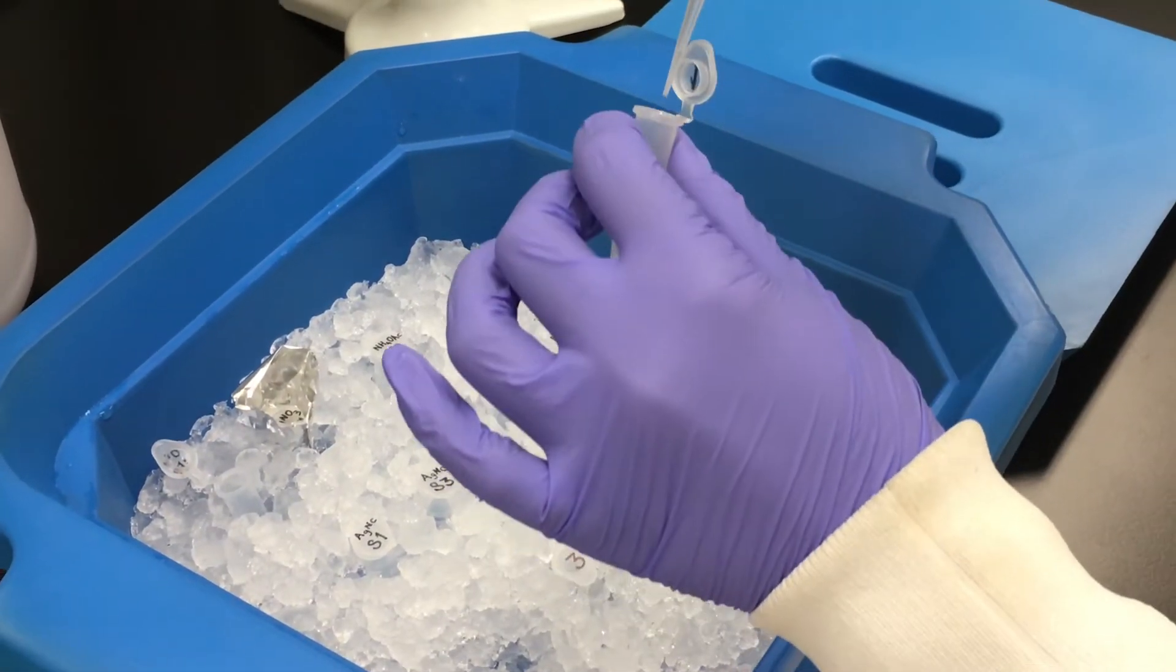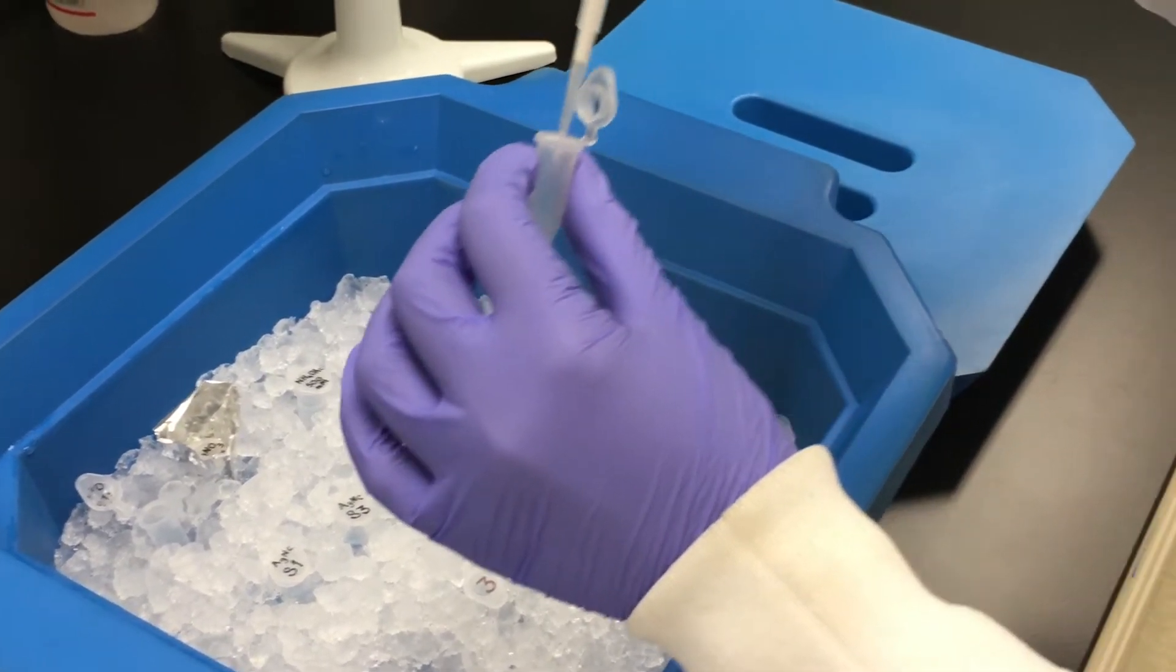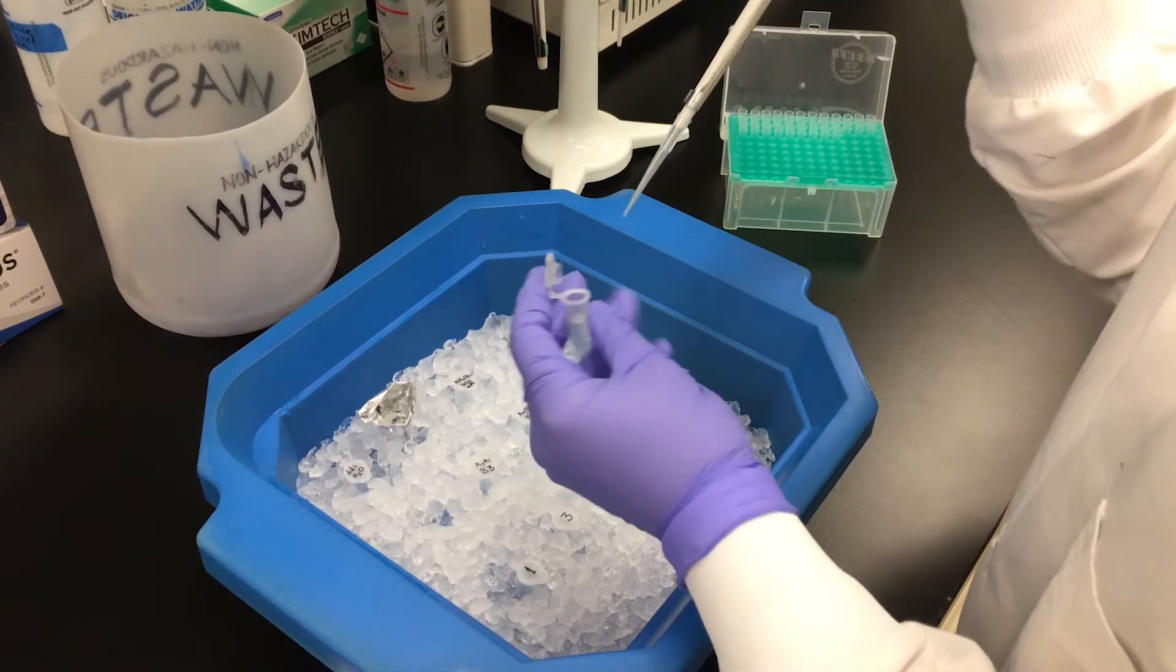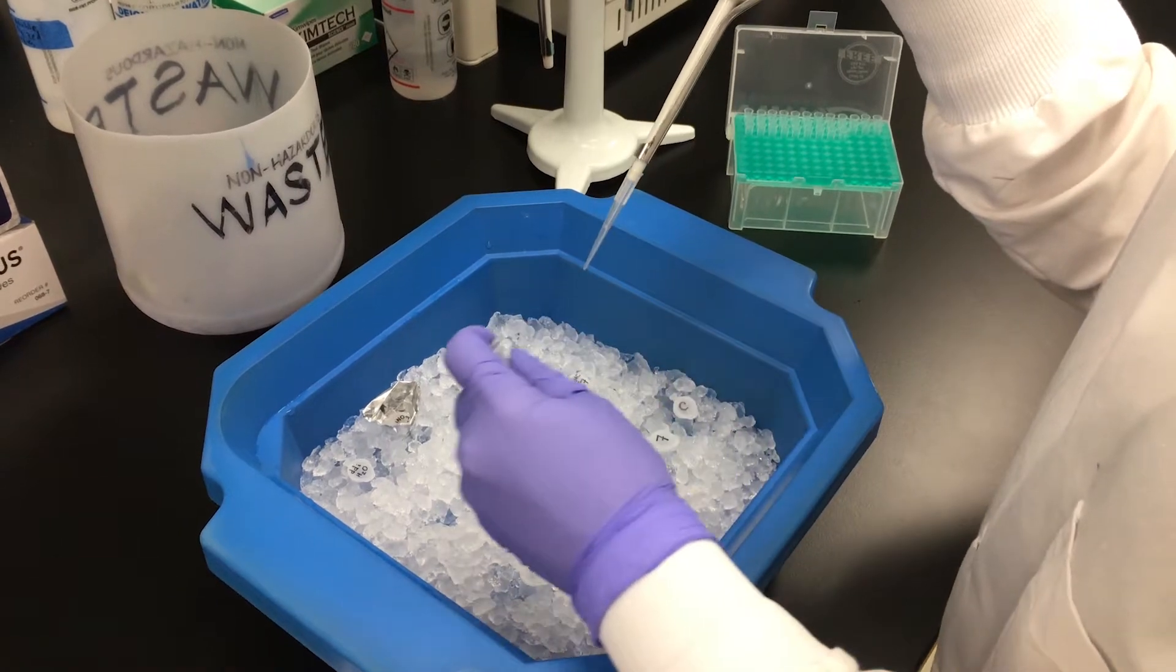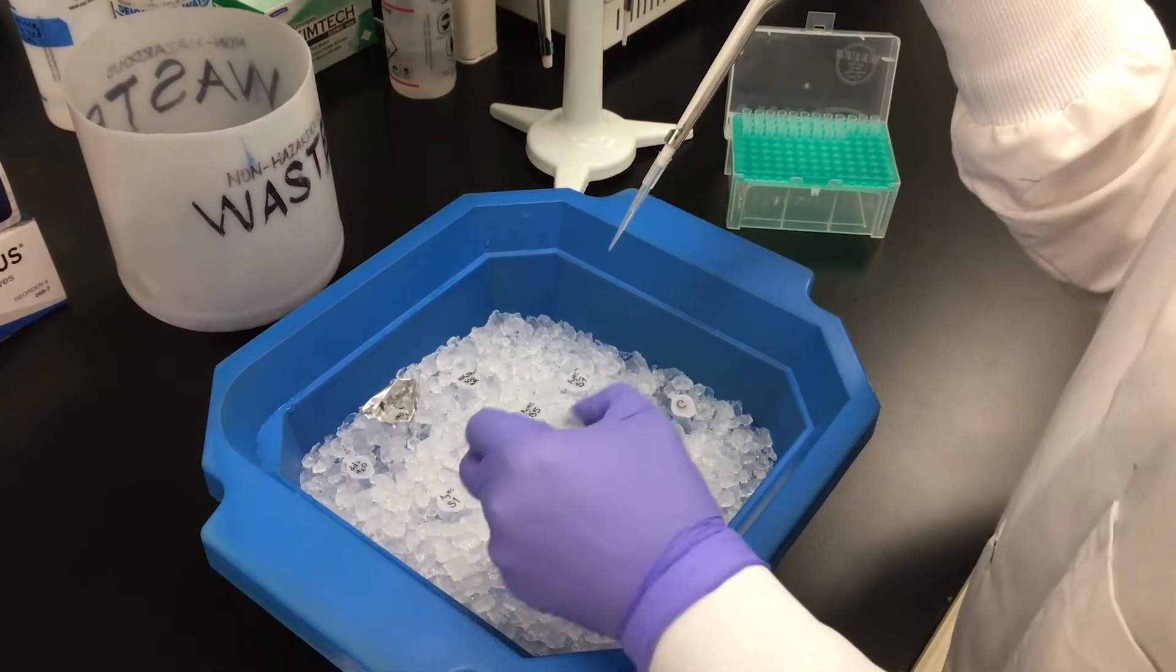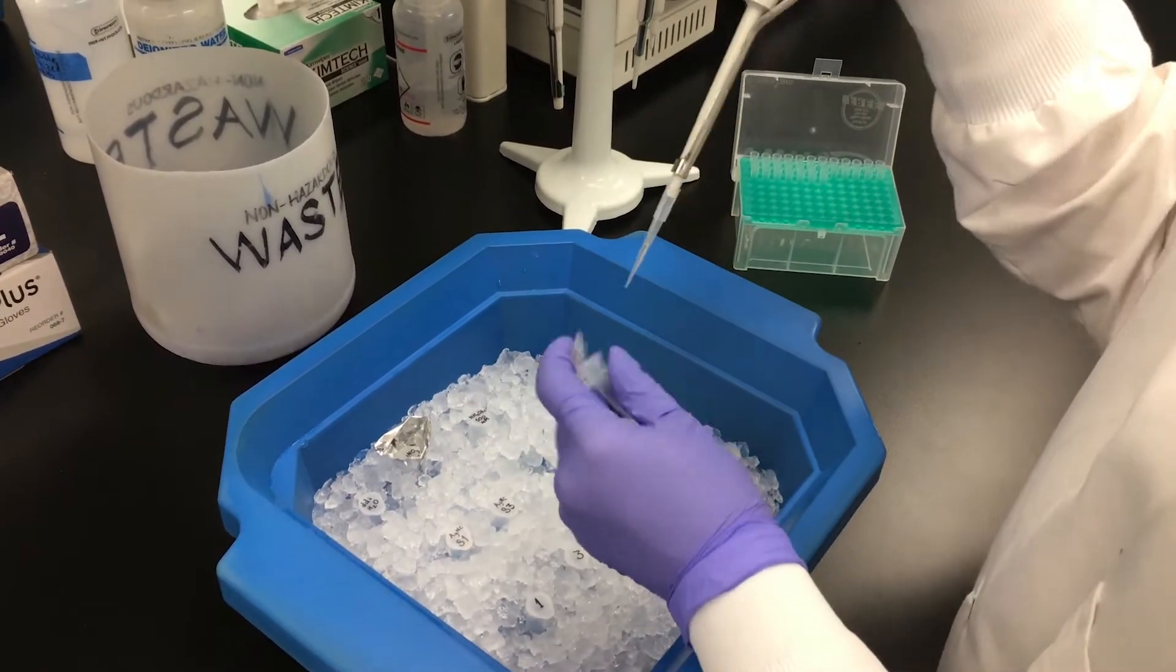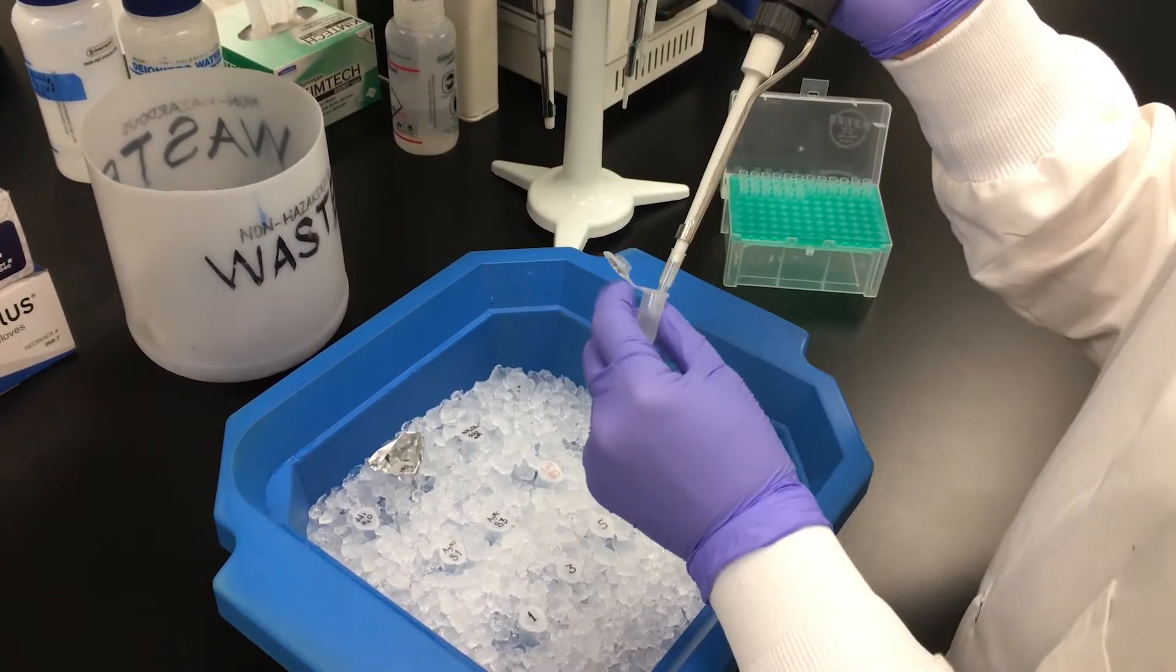Buffer is then added to each of the tubes. Now the DNA template will be added to the sample tubes. The volume required depends on the desired concentration of the final assembly. Here we used a final concentration of 30 micromolar DNA template.